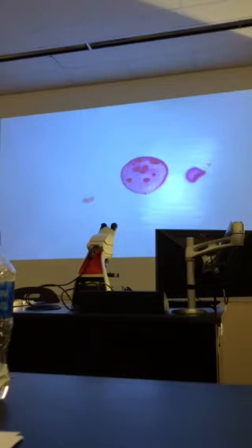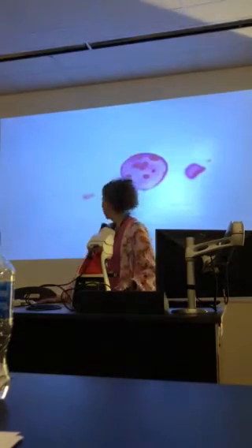It's stained red, but it's actually a green algae. Is it filamentous, unicellular, or colonial? It's colonial. The balls were daughter colonies, and the individual little teensy dots were individual cells. I think of the big balls as a bunch of dots clumped together.